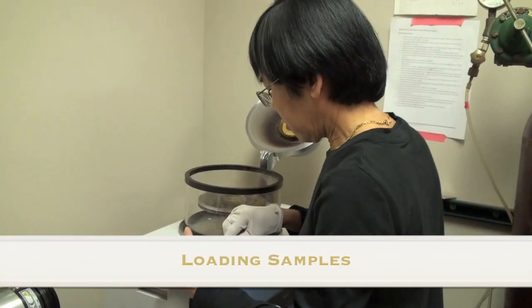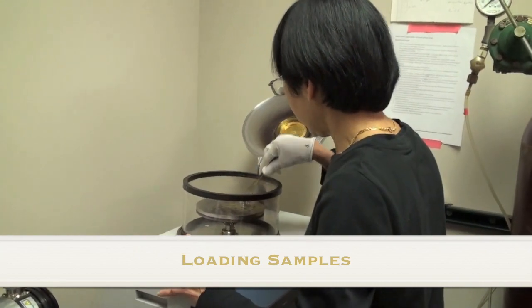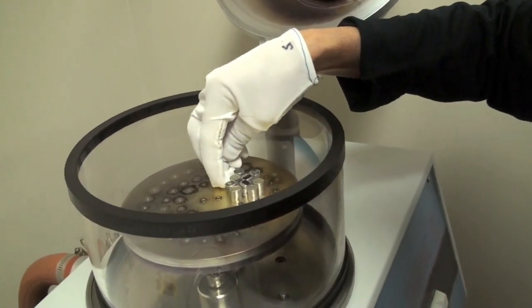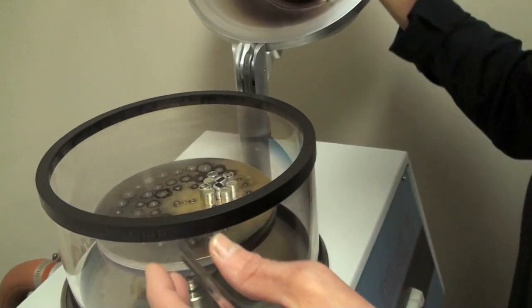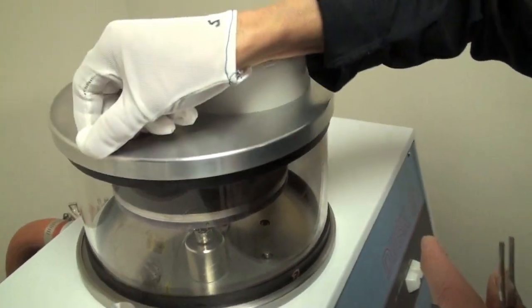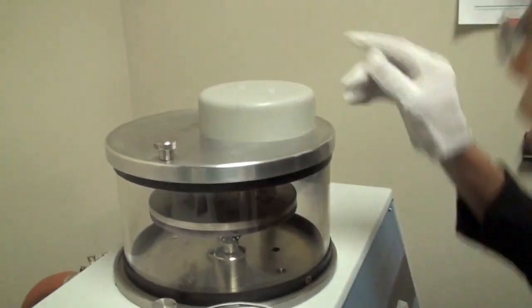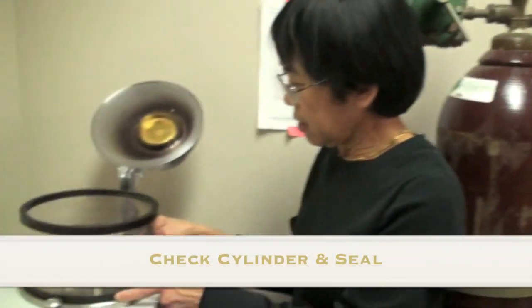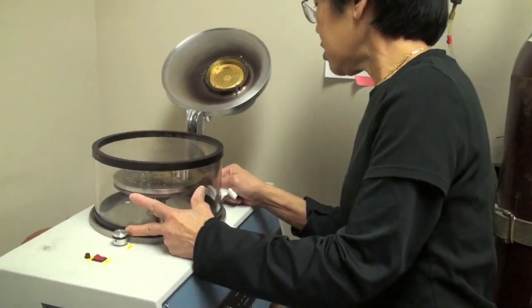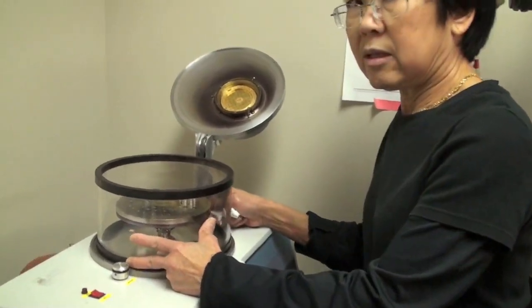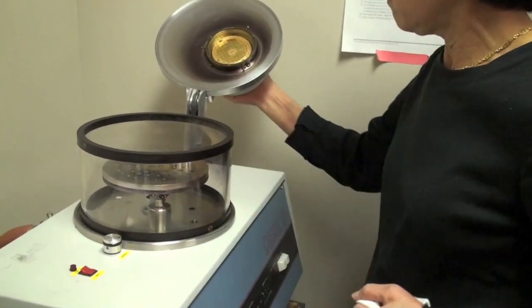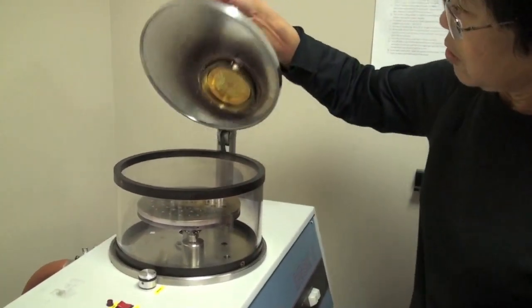So I put SEM around here. The position is so that it's under the gold, like this, under the gold target. And then position this cylinder into the center of the base, because it's sliced, and then it can pinch the gasket. So you put position in the center, and then you just close it.